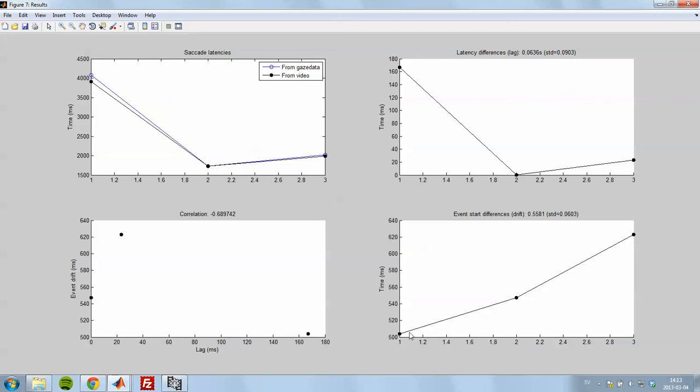You can also see where the events start, or if we have a difference in the events. And this line should be approximately horizontal, otherwise you have a lag in your data, or a cumulative lag, a lag that grows bigger over trials. That's a bad sign. I just did this on 3 trials, so I actually know that this isn't a problem in this file.